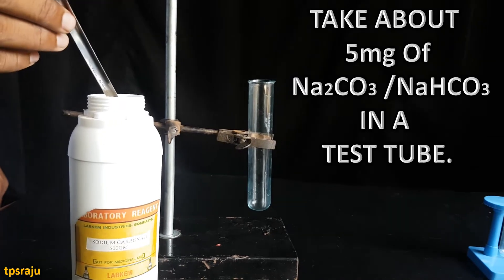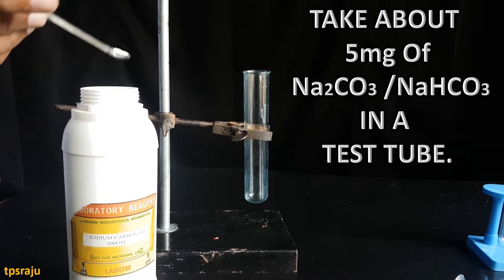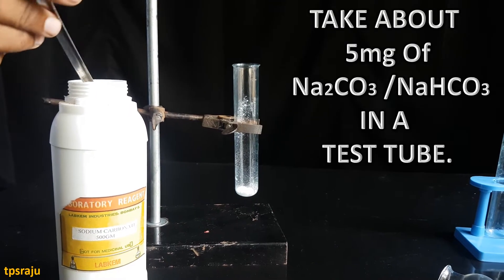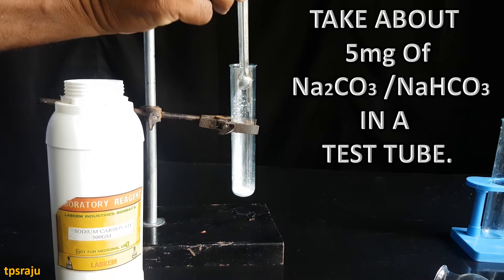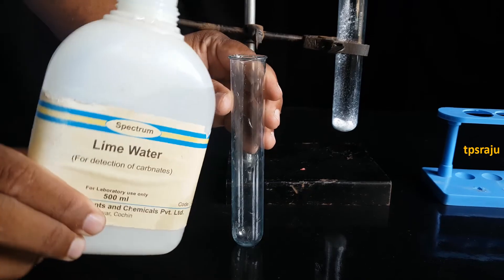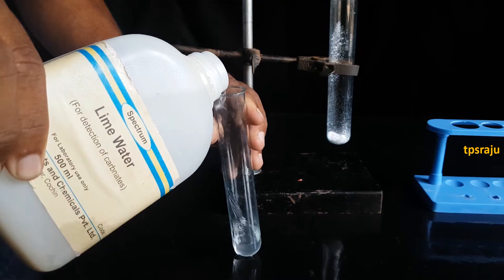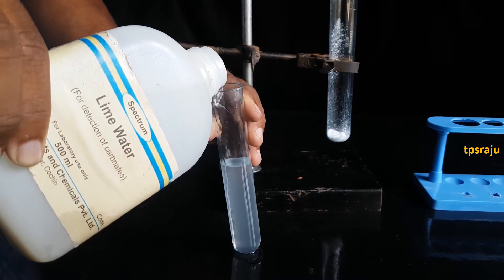First, we have to take about five milligrams of sodium carbonate or sodium hydrogen carbonate in a test tube. Next, take lime water in another test tube and keep it in a stand.